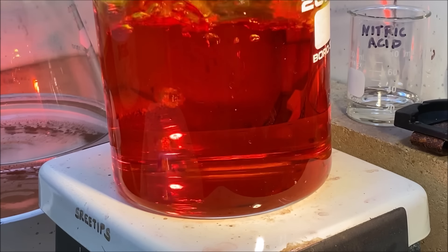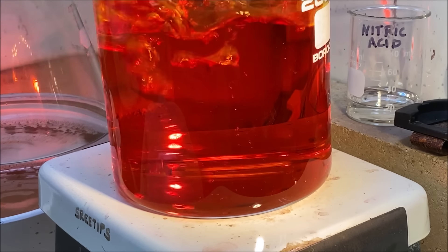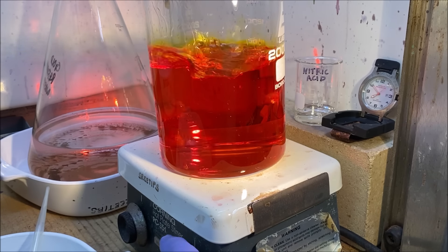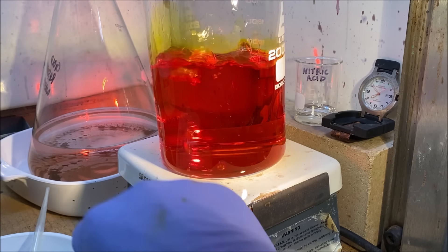I've got every bit of the gold to go in solution, so now what we'll do is we'll take this down off the heat and let this cool off.